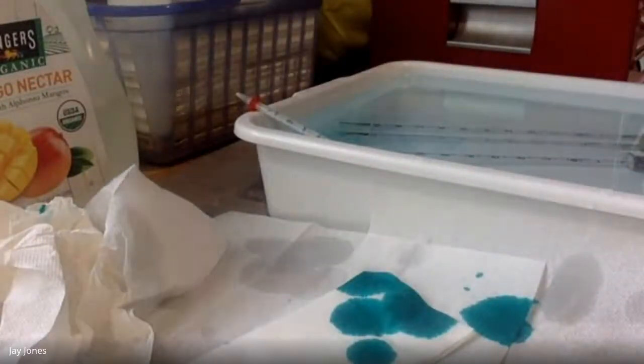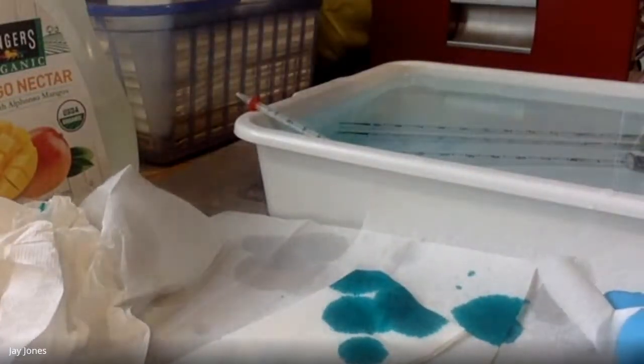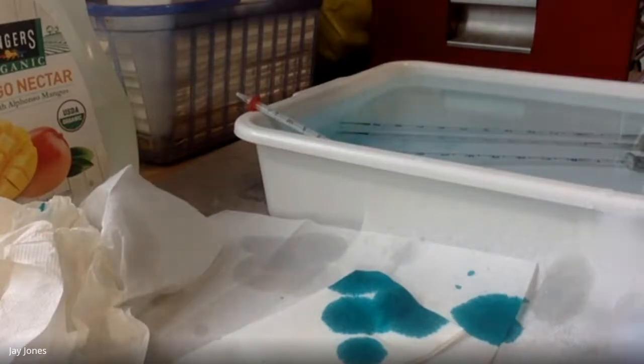Time zero. Time zero. Ready, Shreya? Germ. Yeah. You ready? Yeah. All right. Germ. I'll show you guys, if you can see. Germ is 0.89. Dry, 0.91. Beads, 0.91. Okay, got it. Thank you. Germ is 0.89. Dry is 0.91. Beads is 0.91.